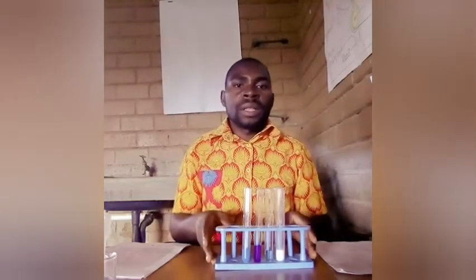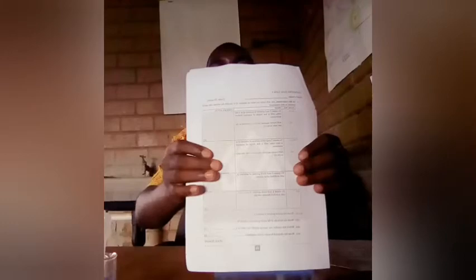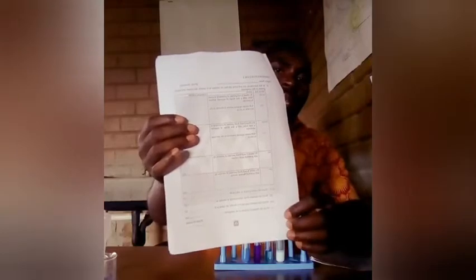So you can see these solutions. Now, since we have this guide here, and we have just used it once, it is time we can use it to answer the questions that are here. Remember, there are questions down there. So the first question says, name the cation present in this compound.